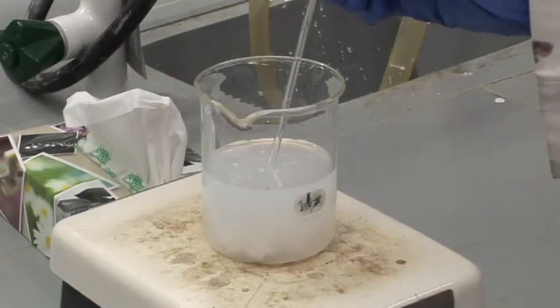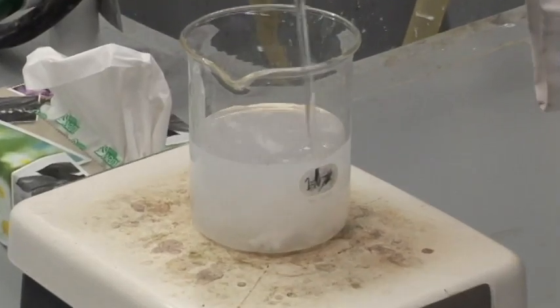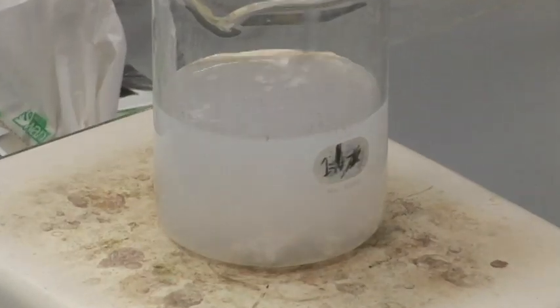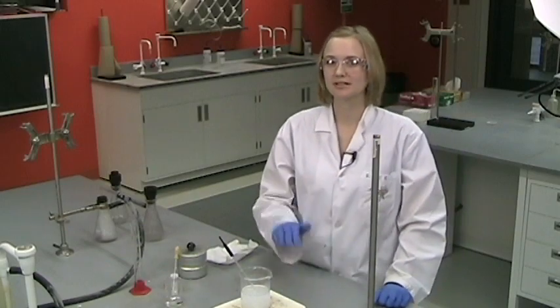Alright, we've been heating for a few minutes, but you can see there are some clumps on the bottom, but the supernatant liquid is still very cloudy. So we want to keep heating it without bringing it to a boil until that liquid is almost clear.